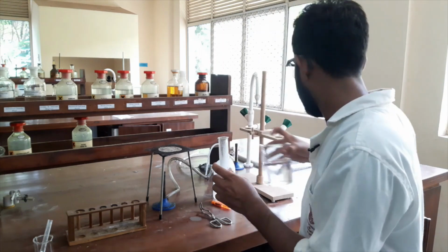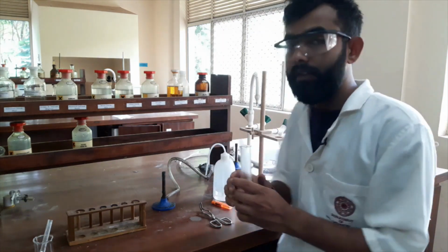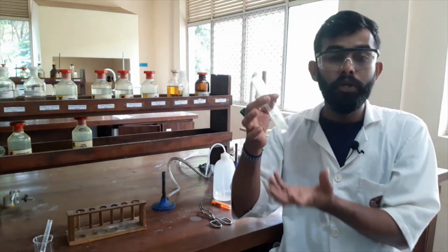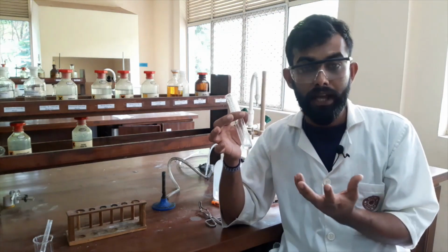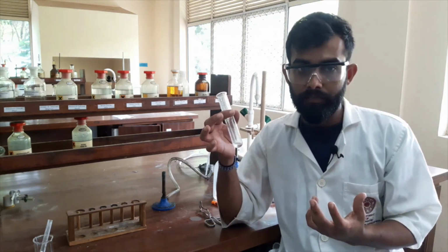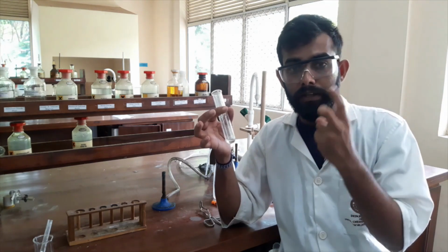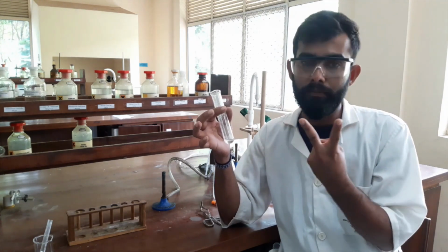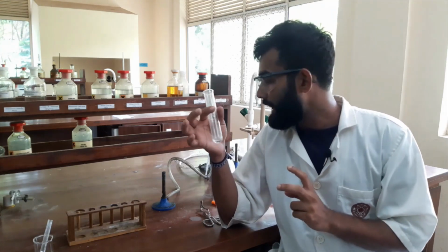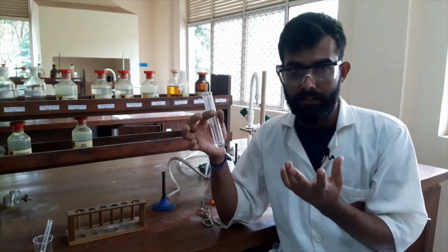That's the first point. While I am heating, the solute is dissolved. But if there are insoluble impurities, there are two types of impurities I told you, soluble impurities and insoluble impurities, I have to remove the insoluble ones by filtering.